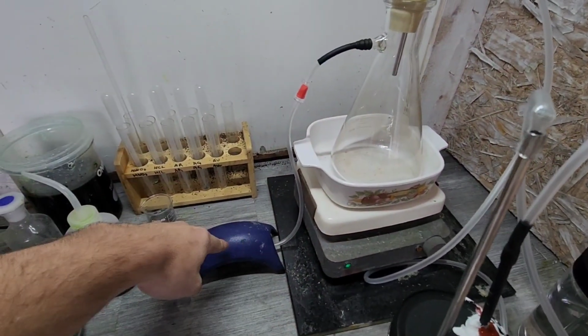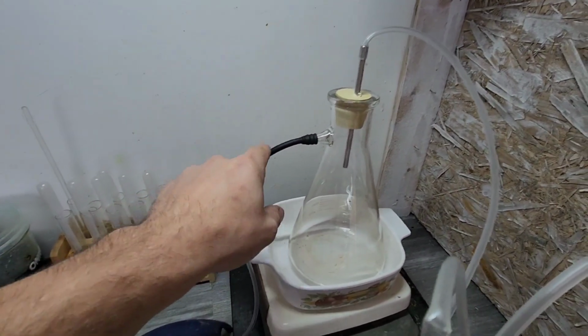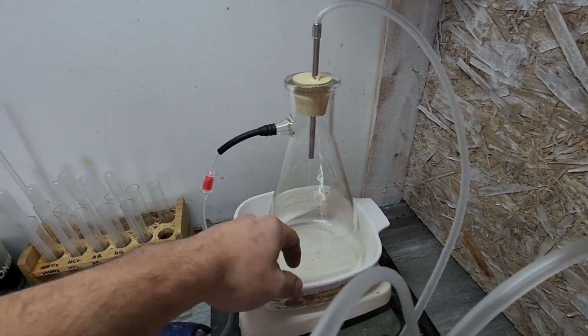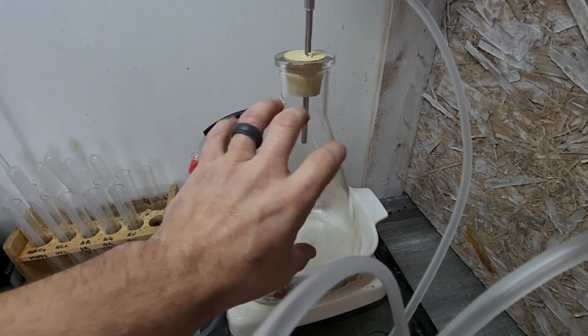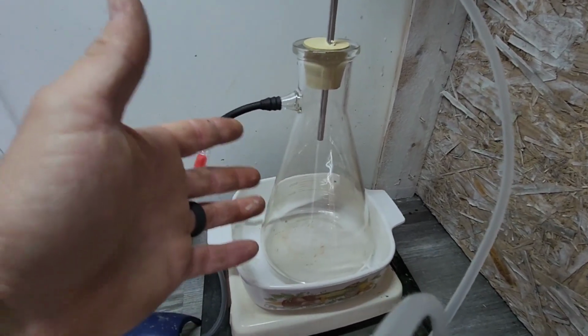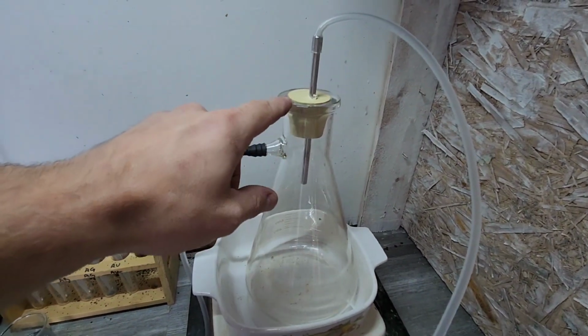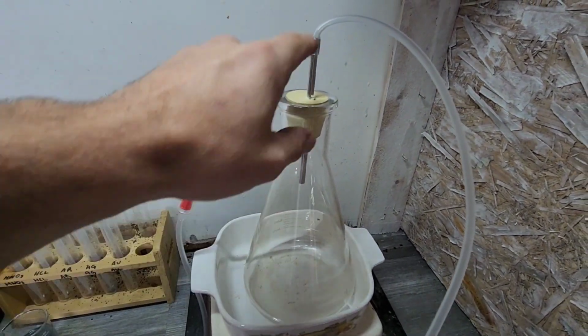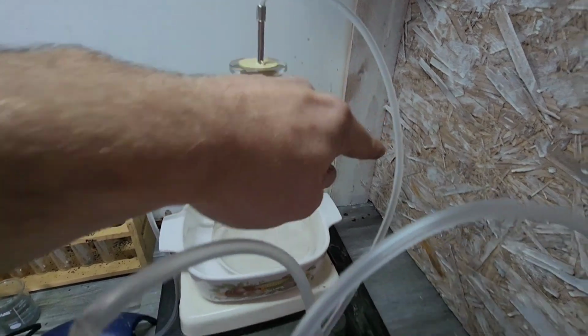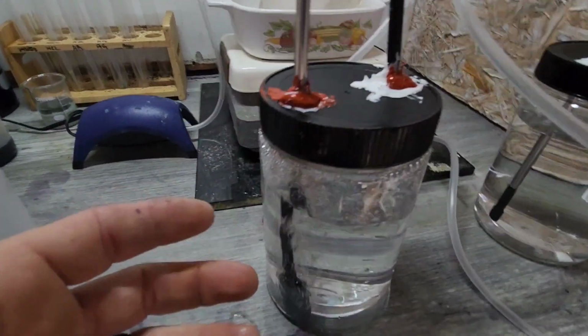Setup. My pump goes into the check valve, so we can't get any air back into the pump. It goes into our flask. I've got to get a better setup. This is basically just the stuff that I had on hand, besides the straw and the extra tubing here. It's going to go out the straw, down into the tube here. This isn't where it's going to be set up, so I just wanted to show you quick.